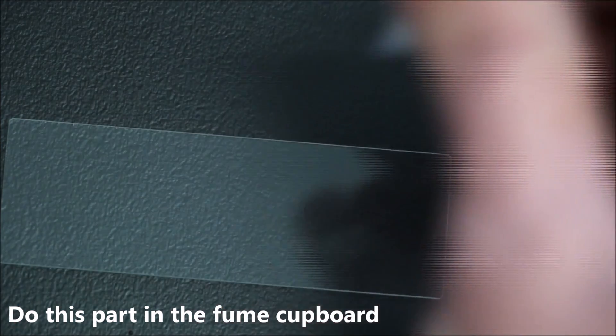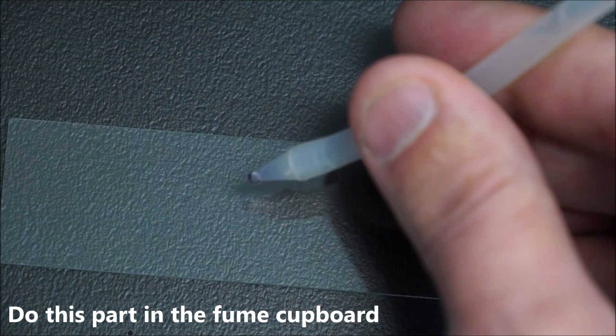You just need a small drop of water onto your slide so your hyphae won't blow away once you've put them on there, and then you can go over to the fungus.